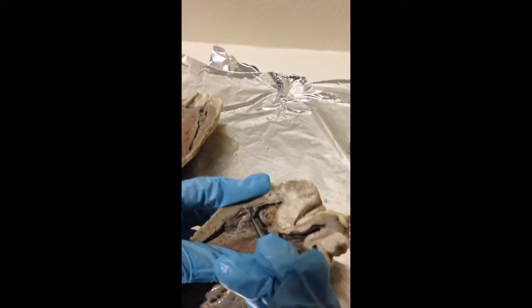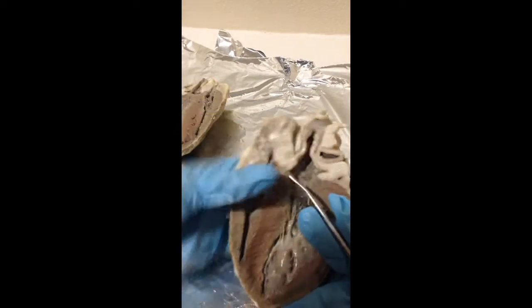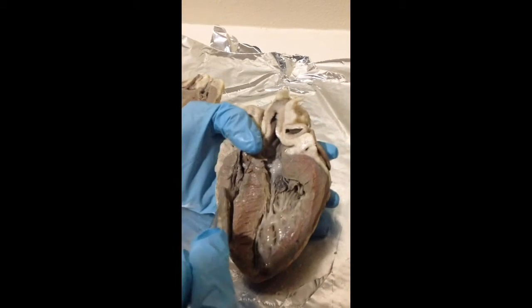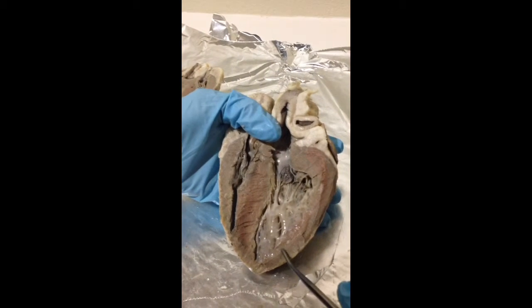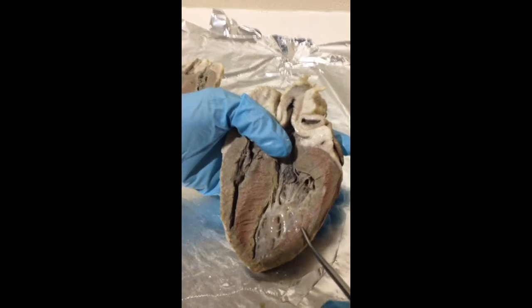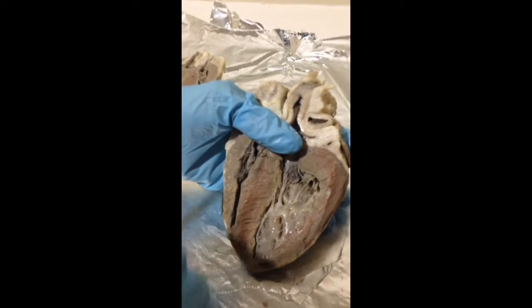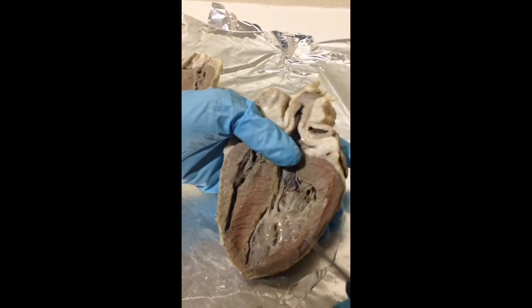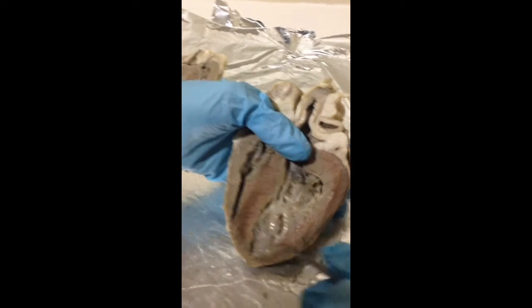These here. And the myocardium of the right and left ventricles is here. This is the right myocardium and this is the left myocardium. It's the middle portion of the layer, and the outer one will be epi and the inner one will be endo. So this is the left myocardium.